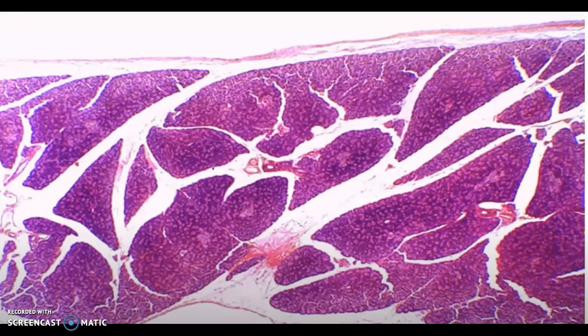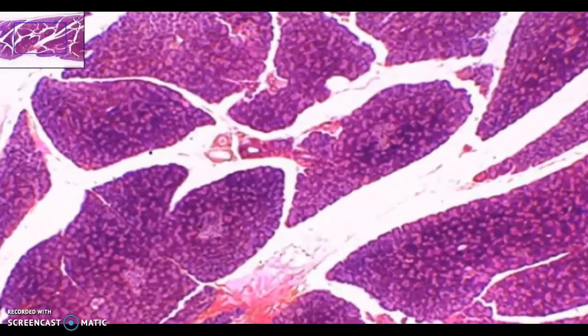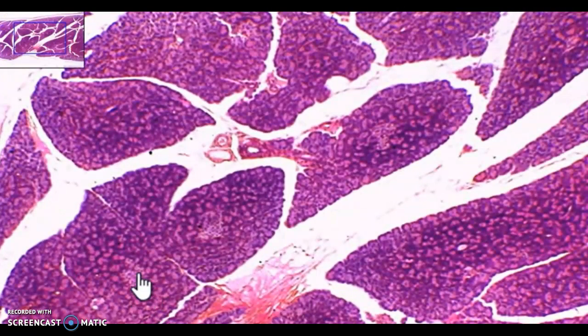Again, this slide is the pancreas. The current magnification is 40x total magnification. And now in this slide, we're going to look at what is endocrine versus the exocrine part in the cells. So if we zoom in a little bit from 40x magnification, you will notice as you go in, there's a little bit of differentiation between areas like this and the surrounding tissues around it.